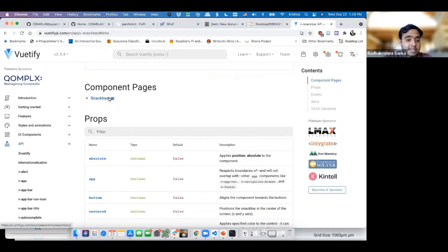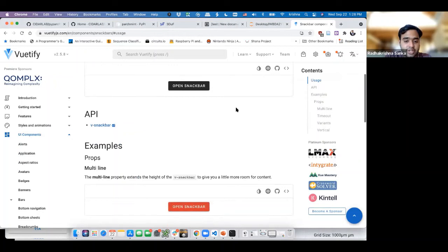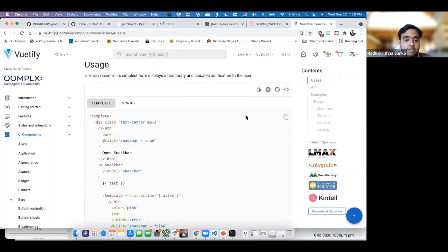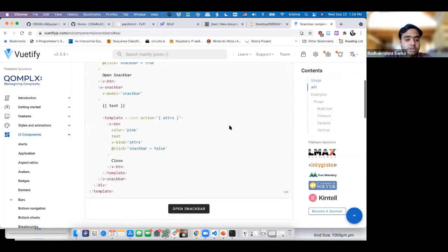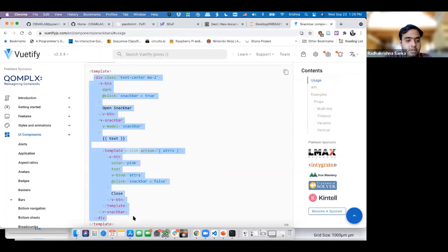But I'm more lazy than that. Instead, I'm going to go to the snack bar page and look at the different examples they have. I'm going to pick the easiest, quickest, dirtiest example, where you click on this button and it shows up a little snack bar notification. So I'm just going to literally copy paste this into my code. I'm going to take this snack bar, model snack bar, that.